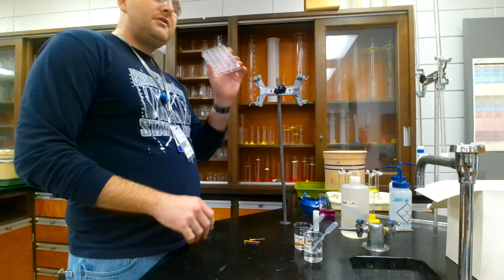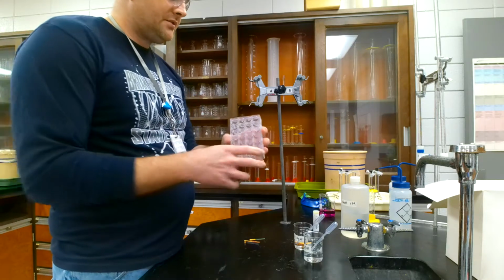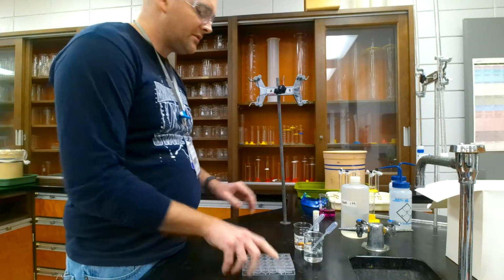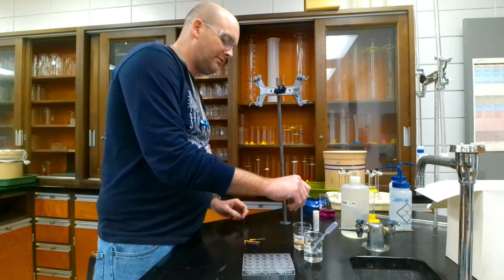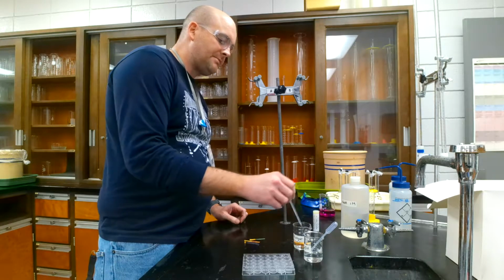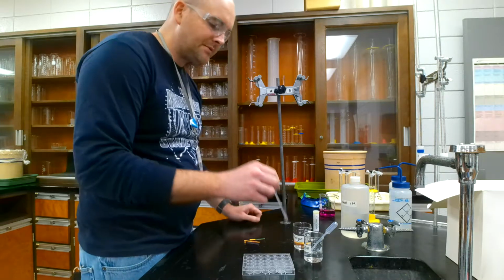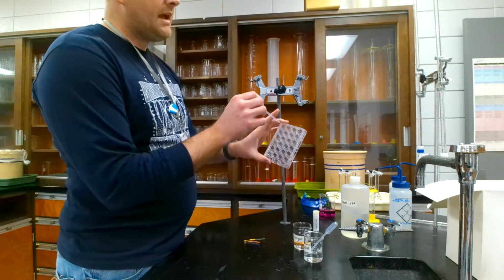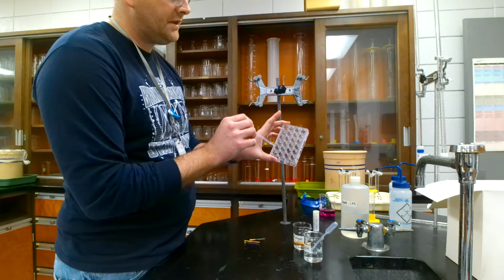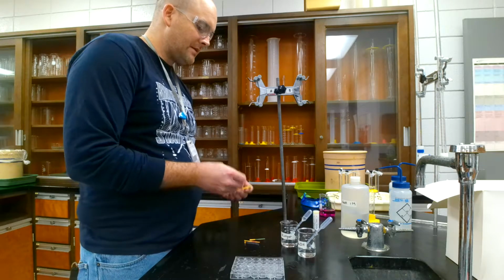And instead of using a burette and all that stuff and trying to fight over those and get it all just right, we're going to use something very simple that's very easy, repeatable, and it also uses the least amount of materials. So I'm going to take 15 drops here. Instead of 15 milliliters before, I'm going to use 15 drops. And I'm going to have to run 5 trials, so I'm going to do 15, 15, 15, 15, 15. Alright? So I have just added 15 drops of my acid.